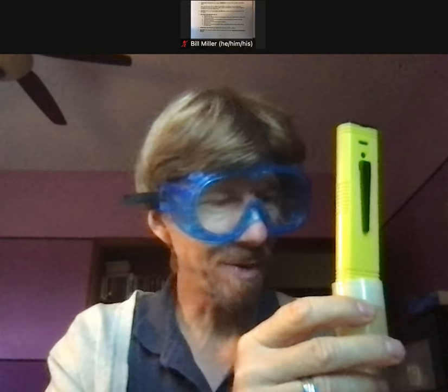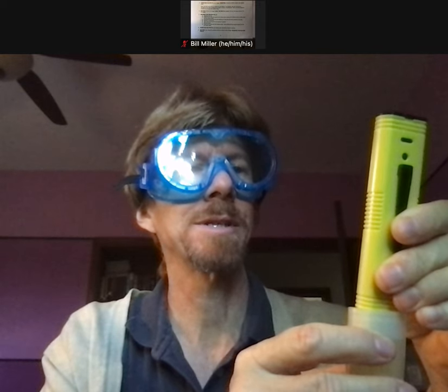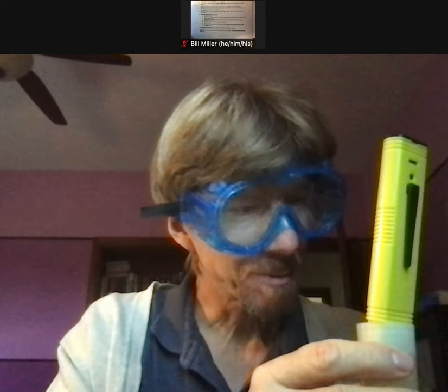It's been about 5 to 10 seconds in the buffer. Mine is stabilizing at around 7.5. I'm going to press the CAL button for two seconds and it should flash — it's flashing 6.86. I know it's in pH 7 but it says close enough, and then it says 'end,' just like in the procedure.